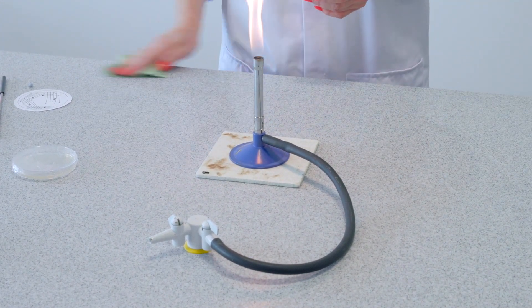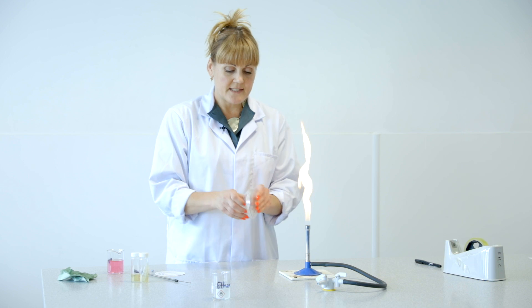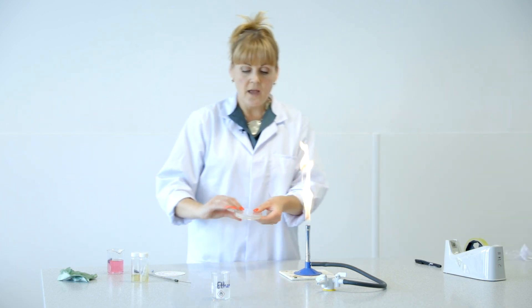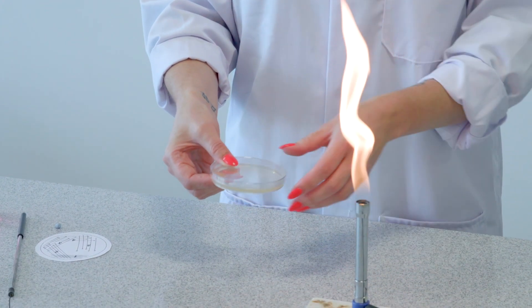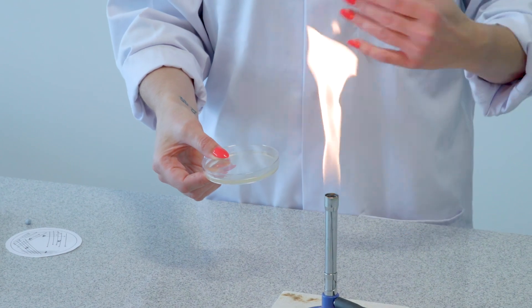You don't need to dry it. I've doubly disinfected it now. The Petri dish will look something like this — this has been pre-prepared by our technicians. When you're removing the cellophane, please make sure that the lid does not come off because then you risk contamination. Place the Petri dish as near to the Bunsen flame as possible, because you want an aseptic environment where you're not going to risk contamination either from yourself or to yourself.